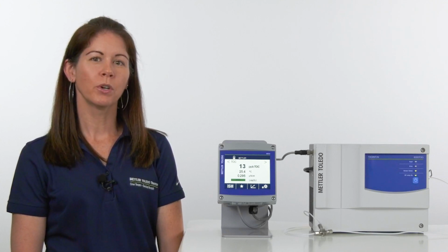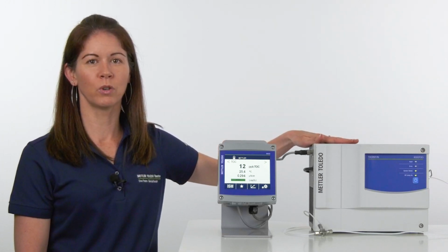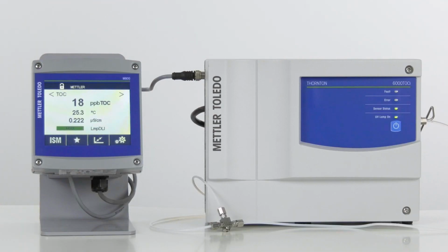In today's video, we're going to watch how the 6000 TOCi responds to contamination in real time. I'm currently sending clean, ultra-pure water through the TOC via a three-way stainless steel valve. As you can see on the transmitter screen, it's currently reading low double-digit ppb levels of TOC.